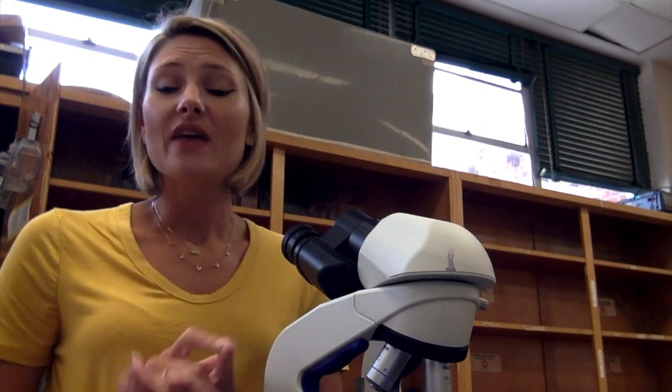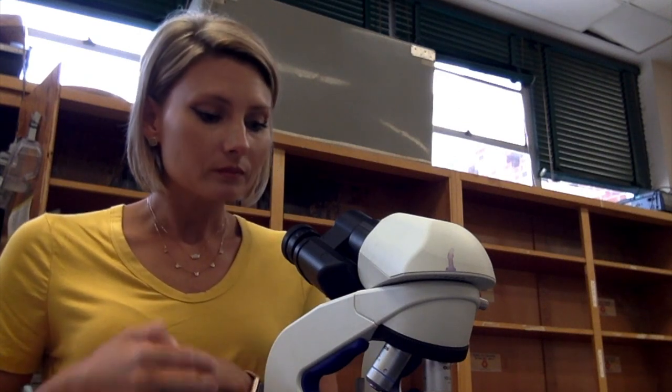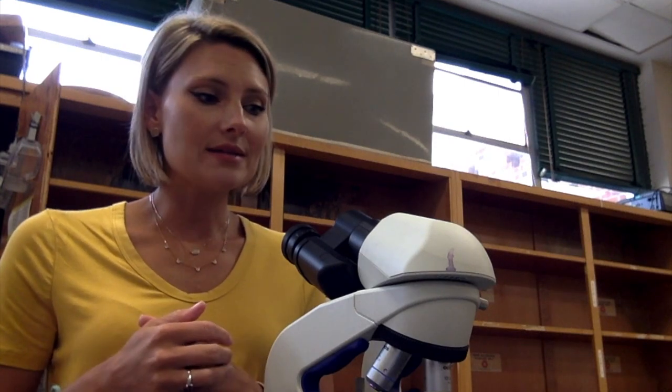Once you get down to 100x, you can see the individual bacteria — the size, the shape, and the arrangement. If you were doing other stains, you could see additional details on top of those things. So that's the microscope: the parts, the different equations, and a quick tutorial on how to focus the microscope.